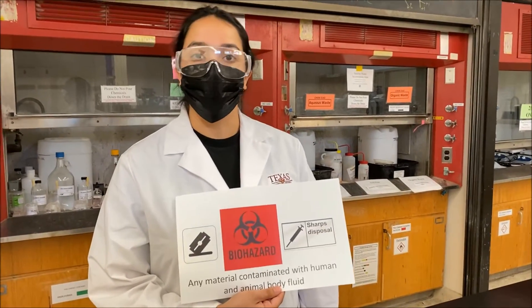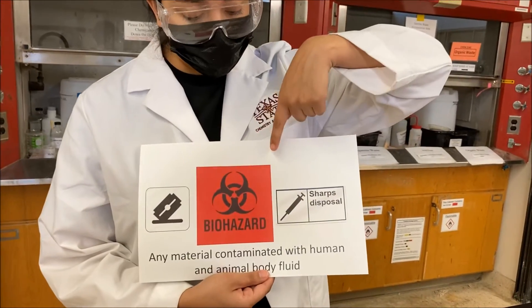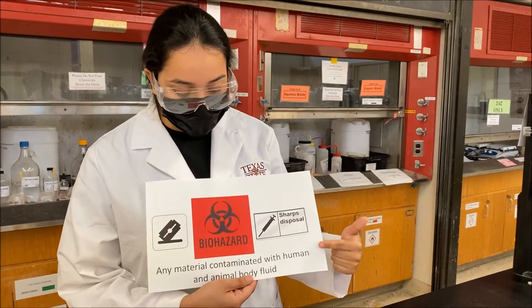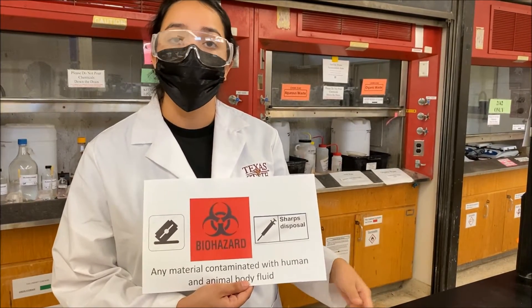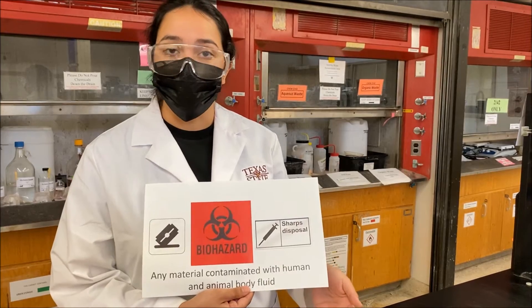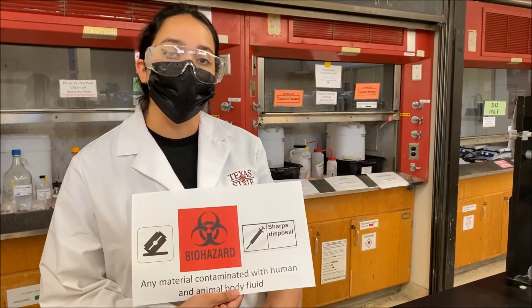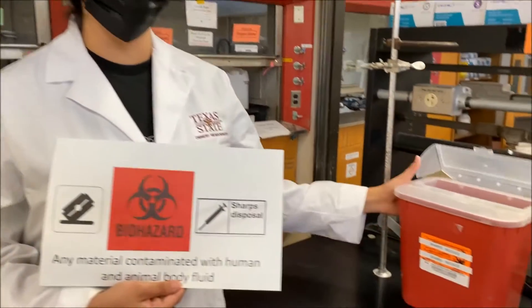Another important chemical sign to know is the biohazard symbol. In biohazard containers, we place any material contaminated with human or animal fluids, including blood or plasma. We also dispose of sharps like needles and razors in a designated sharps container.